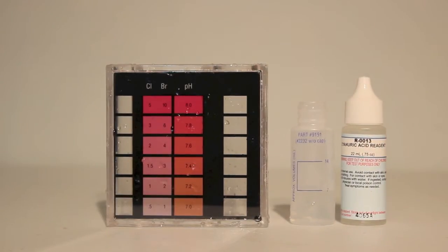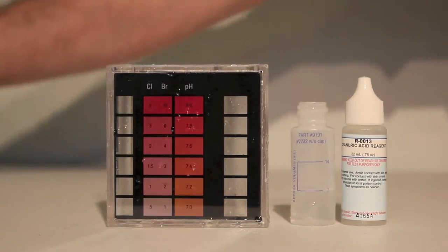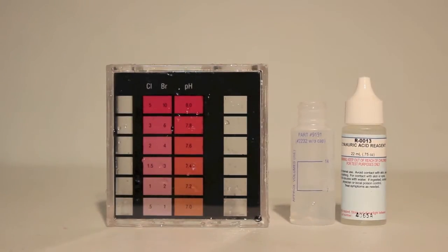We will be using the cyanuric acid reagent, filling the container to line number 14. Then we'll shake for 30 seconds.